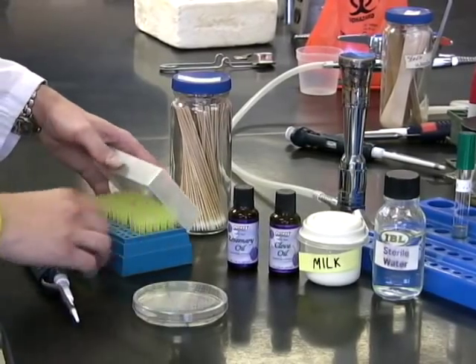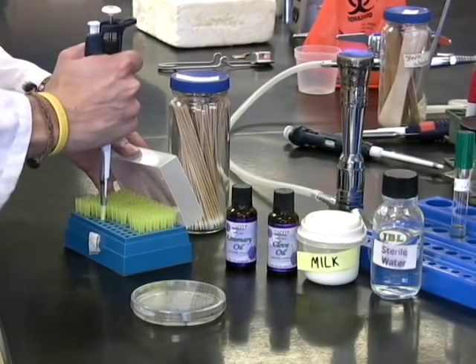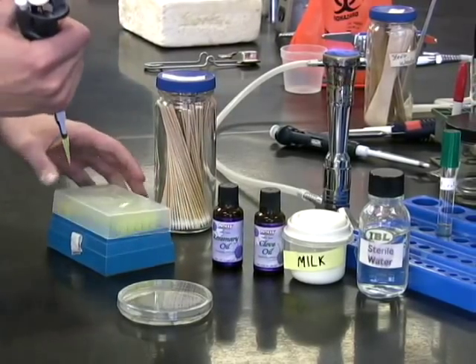Using a P20 pipetman, you are going to carefully pipet 5 microliters of each of the food products into their respective quadrants.